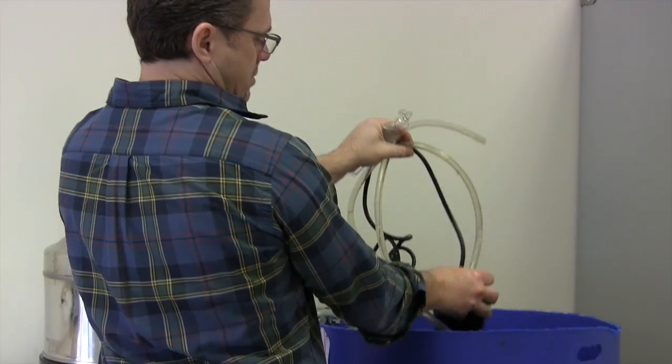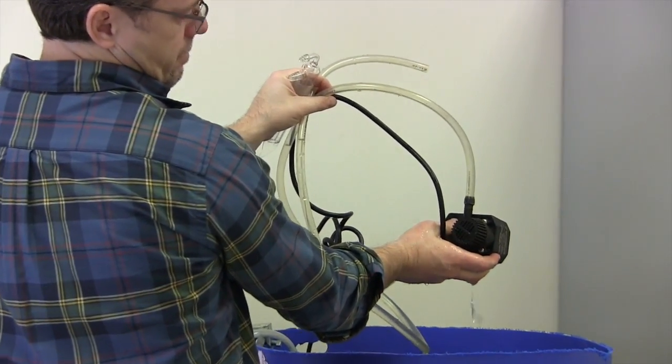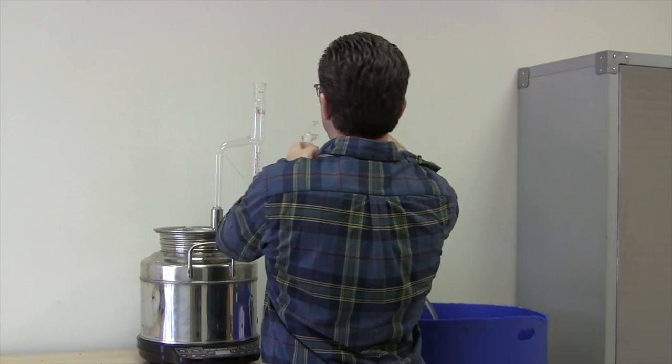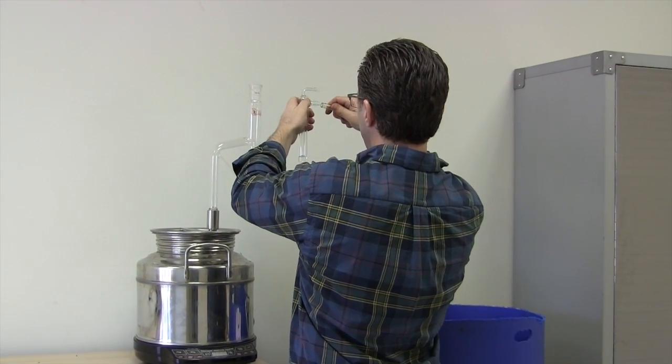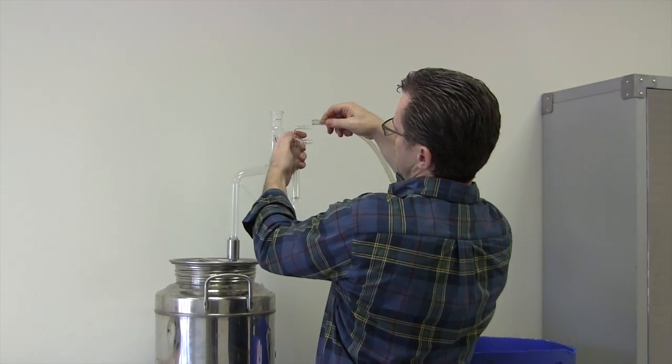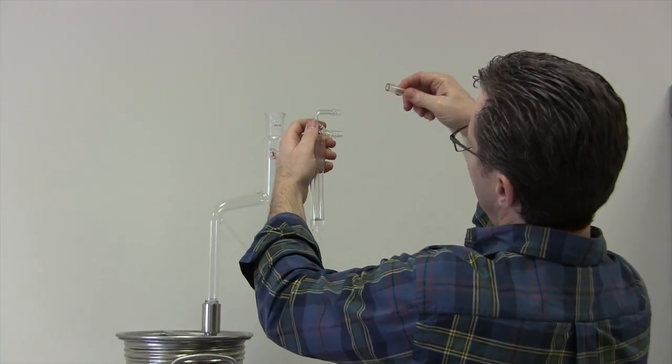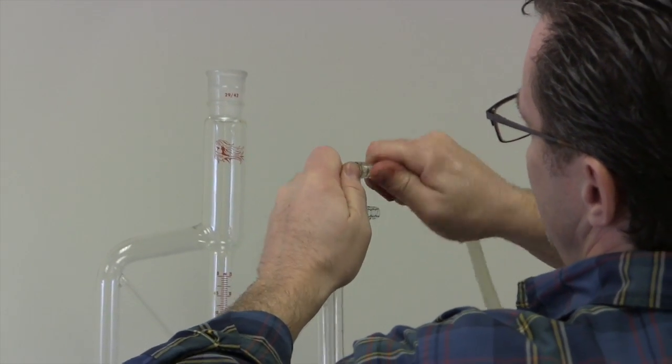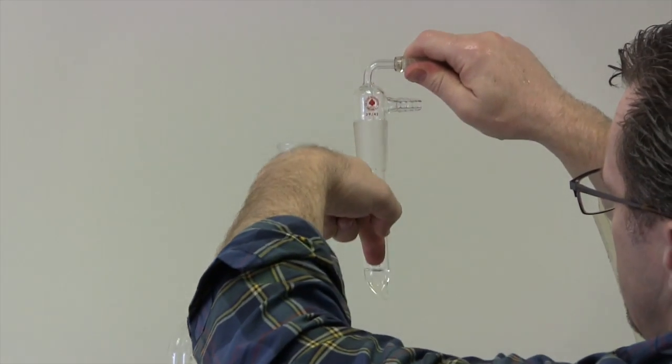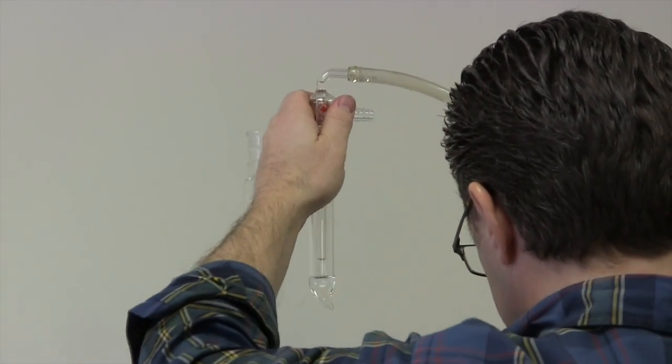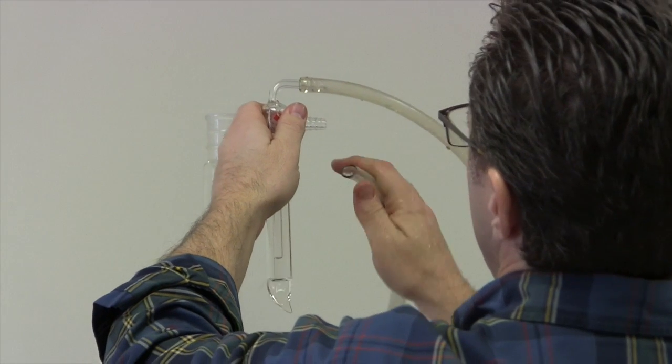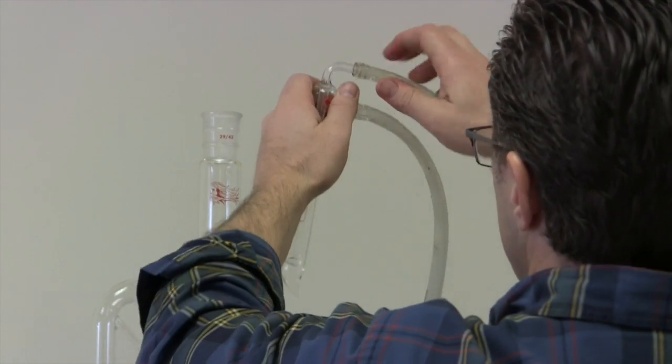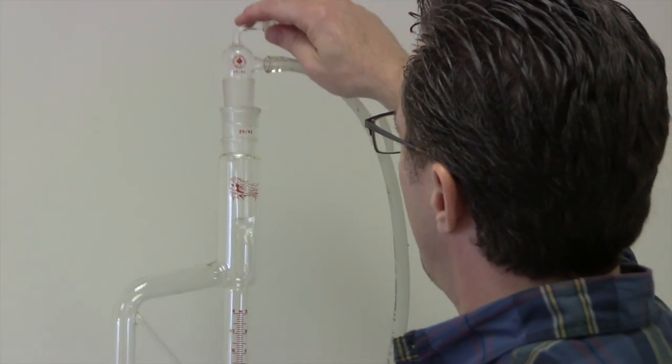Let's show you what it looks like, you know, 50 bucks at Home Depot. And I've got a very large vat of water here to cool the condenser. So the condenser, the pump is going to go into the water inlet, which is the top tube, which goes straight down through the center of the condenser, and then back out. And you have an outlet tube that channels the water back into the water reservoir.